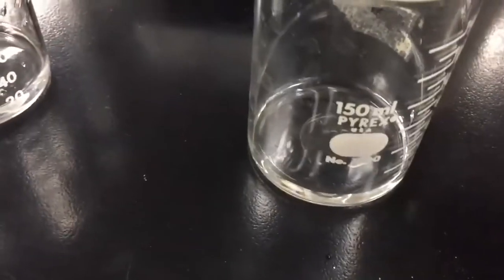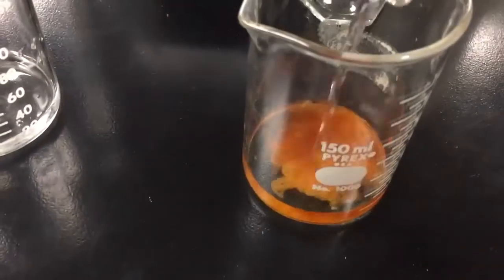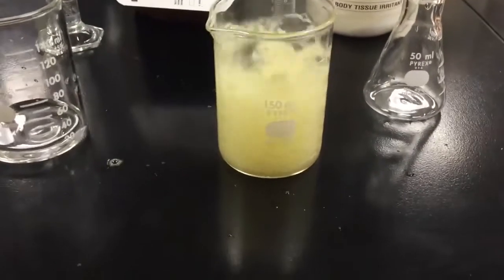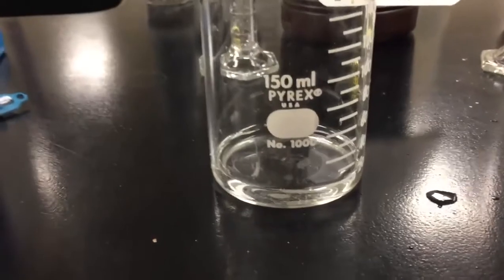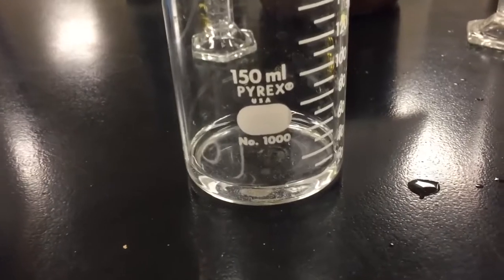So let's add the iodide ion to the hydrogen peroxide solution, and you can see that it reacts very, very quickly to decompose. We get the brown color there, and that brown color is the result of I2 being formed. But essentially it's the iodide ions that react, and there we go. The hydrogen peroxide is now completely decomposed to water and oxygen gas, while this one is still slowly reacting. It might take 10 or 15 years for that to eventually decompose without the catalyst.